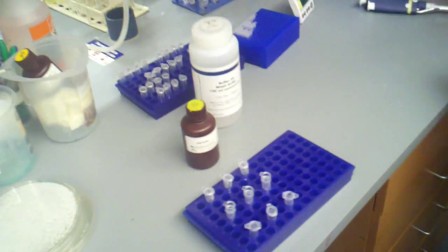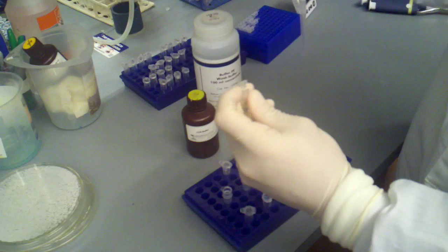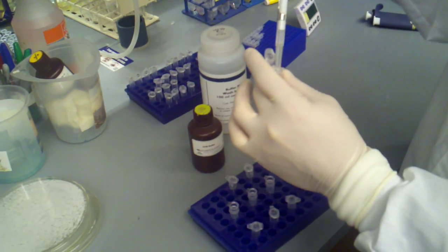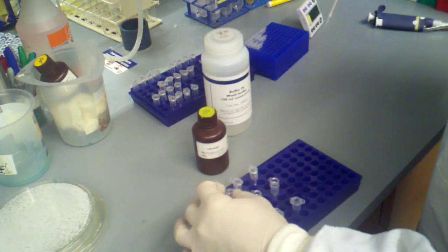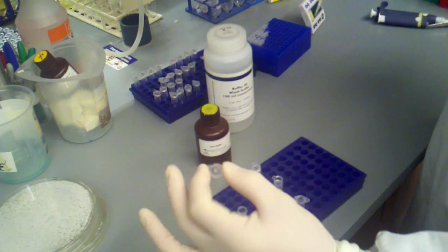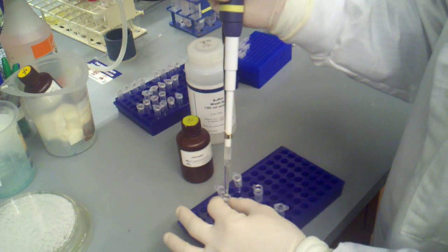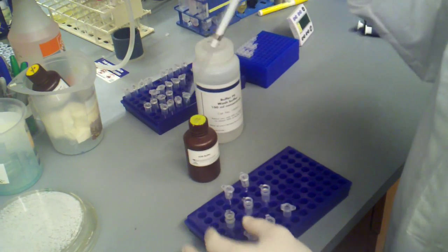I'm going to grab my P1000, set it to the full 1000, and load all this liquid over my Zymo column. I'm using a Zymo column, again, very different from a Miniprep column. Zymo columns are smaller, and they just have a tab. They don't have the cap on them, so this procedure calls for a Zymo column.